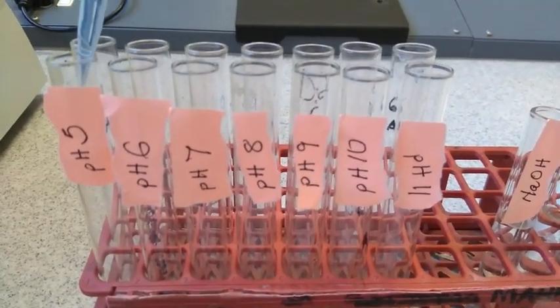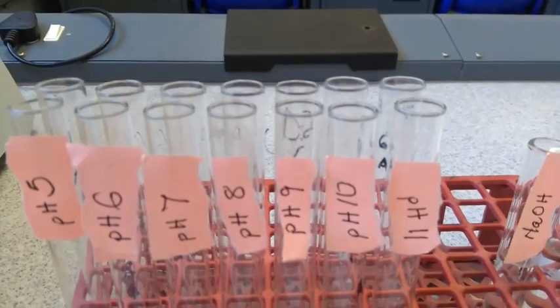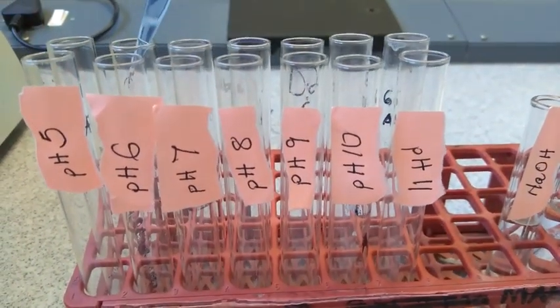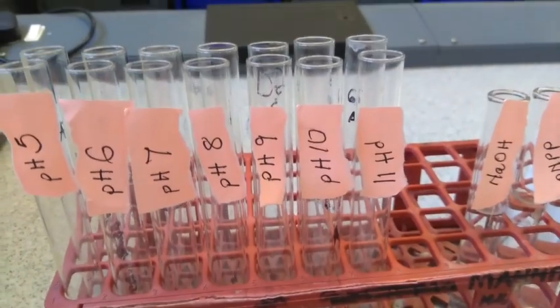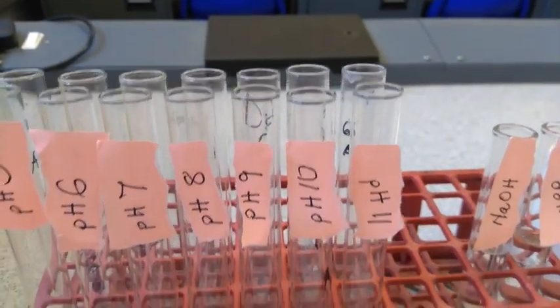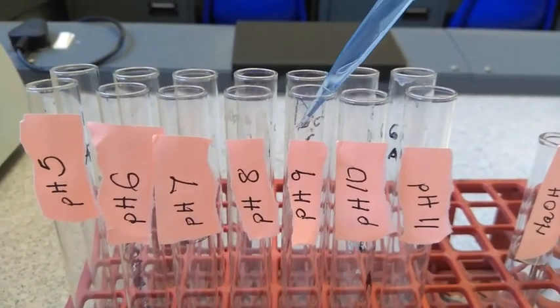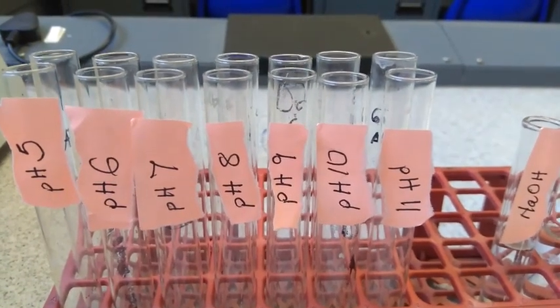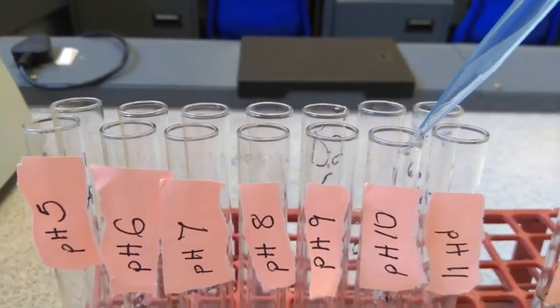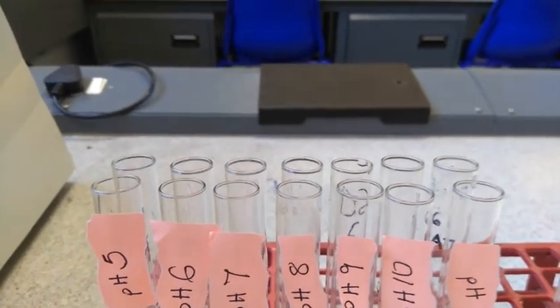We will start by adding one mil of each pH buffer solution: pH 5, pH 6, one mil of each, then pH 7, one mil in each, pH 8 — and each time we will have a duplicate — pH 9, pH 10, and pH 11. So there we have our buffers.